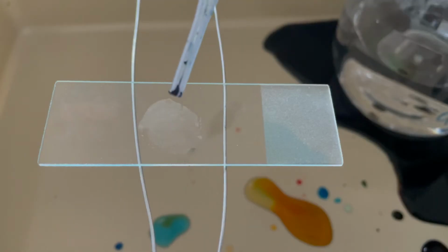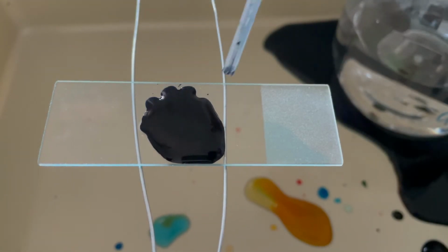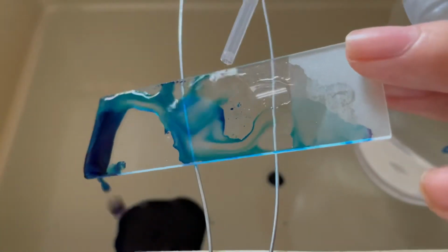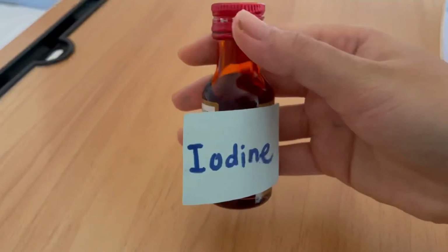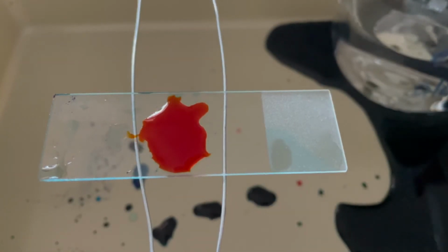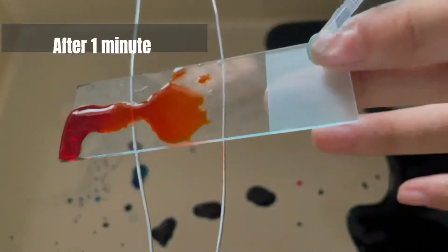Firstly, the smear was flooded gently with crystal violet for 1 minute. Then, gently wash off the stain with tap water. After that, gently apply Gram's iodine for 1 minute. This step is known as fixing the dye. Gently wash off the iodine with tap water.